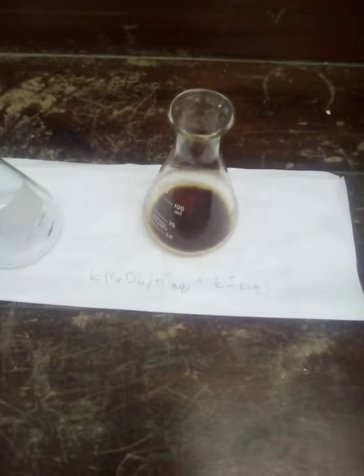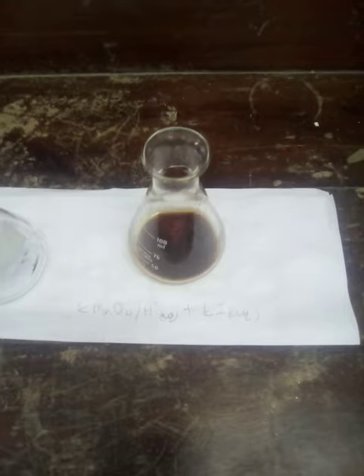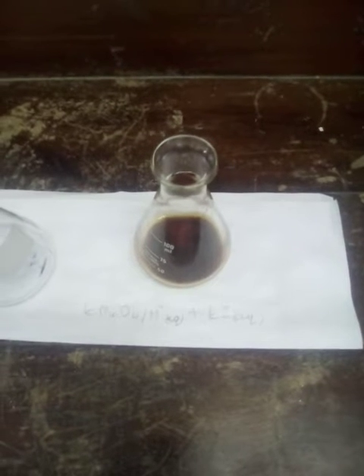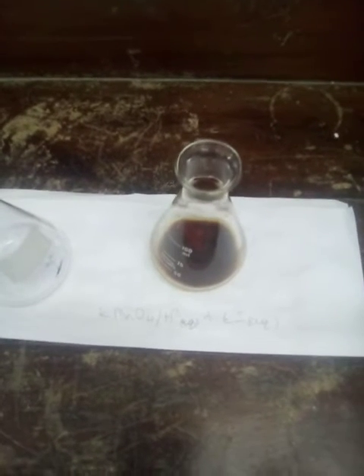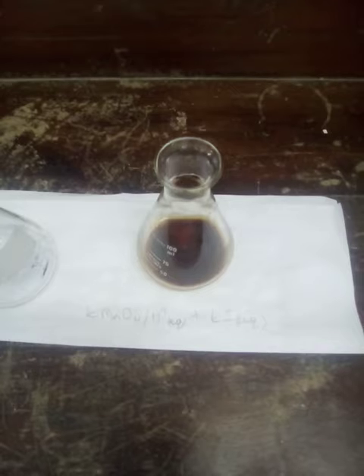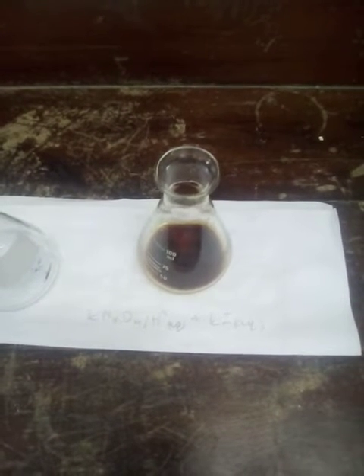Good day again, guys. Today we're going to look at how we can test for the products of a redox reaction. In particular, this redox reaction that we're going to test one of the products for to determine if this reaction actually occurred is we're going to test for the presence of iodine, elemental iodine, right? So we're going to test the iodine in this mixture.